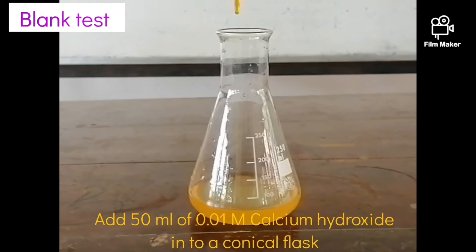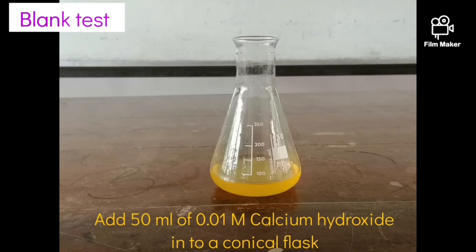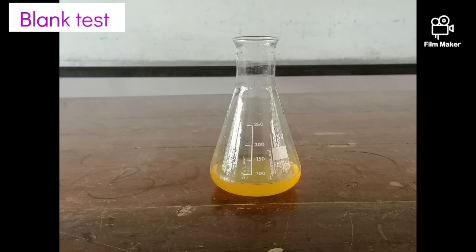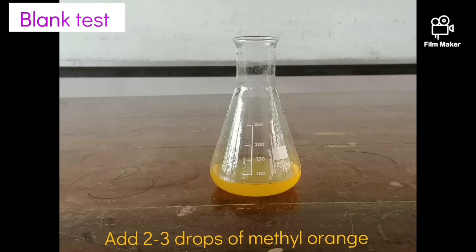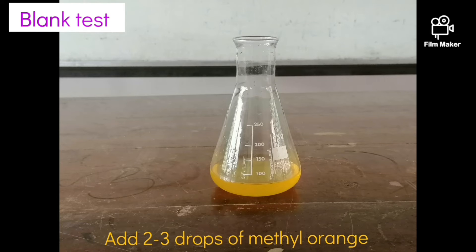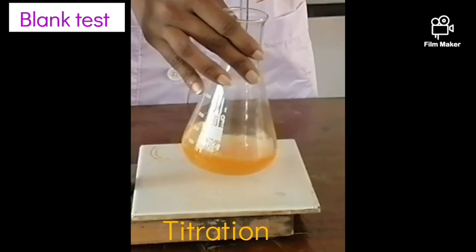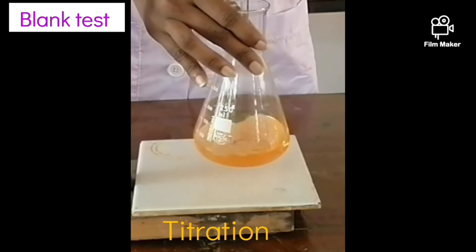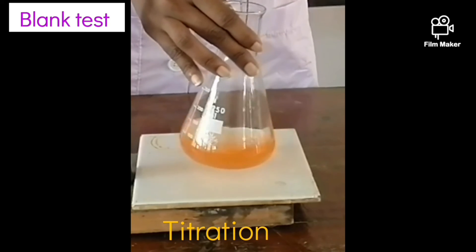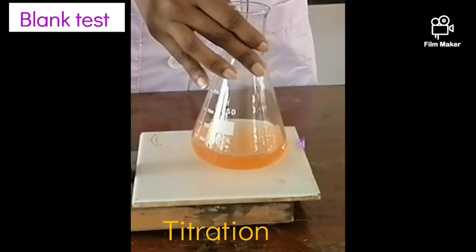For the blank titration, pipette out 50 milliliters of 0.01M calcium hydroxide solution into a 250 milliliter conical flask. With methyl orange indicator present, repeat the titration against 0.05M sulfuric acid solution. Then record the burette reading at the end-point.